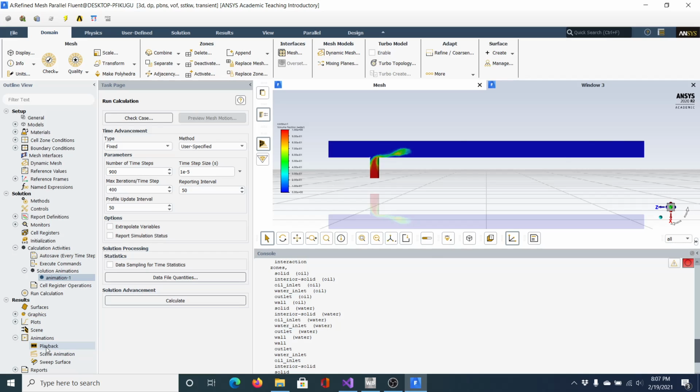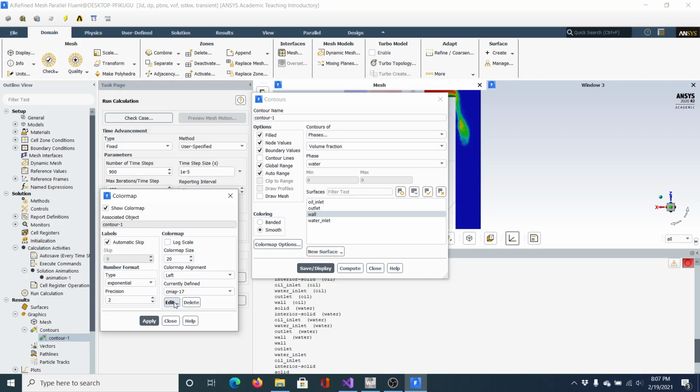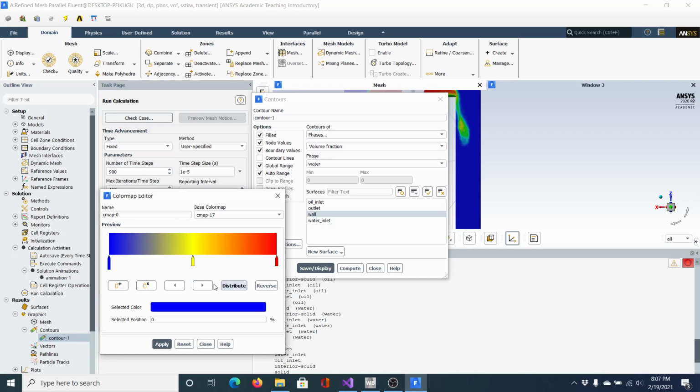I think, oh, one more thing, contours. So some papers that we've seen don't have as many colors. As you can see here, there's a wide variety of colors. You can change that. So if you go into graphics, contours, and you bring up your contour, you can do color map option. You can edit it like I did, and you'll see a bunch of spots here.